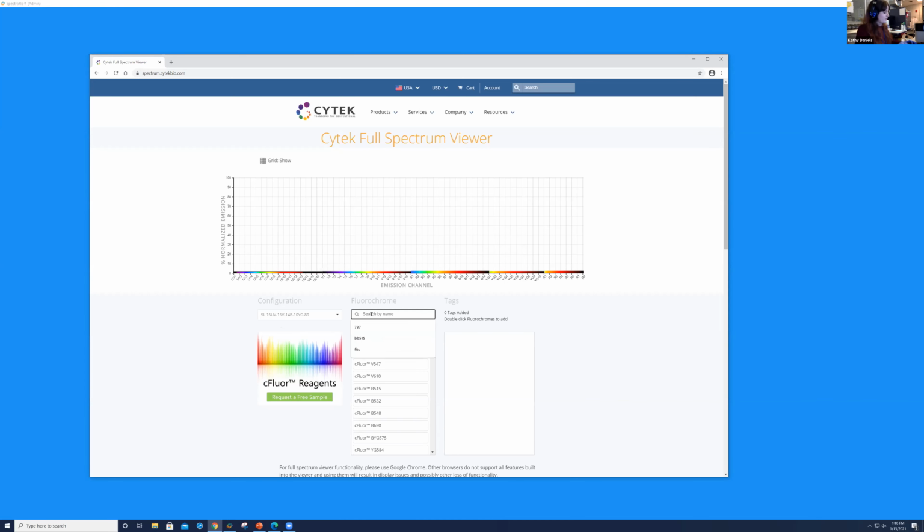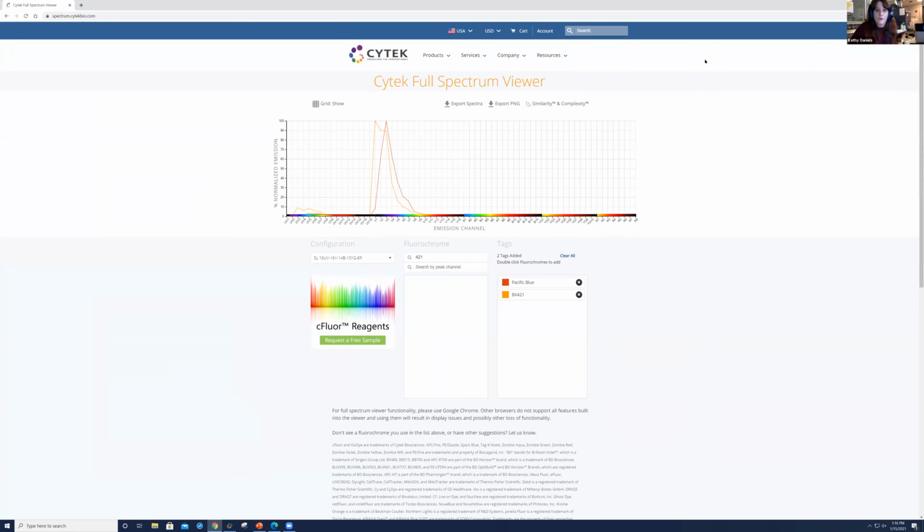And I'm going to start searching for those two fluorochromes. So Pacific Blue is my first fluorochrome that I'm going to be using today. And by double clicking on it, we see the emission spectra on this full spectrum plot. From there, we're going to add in BV421. So I start typing in 421, it pops up, and I double click on that fluorochrome right here. Once that pops up, you can see that we do have 2 distinct emission spectra. So this might be something where you look at it visually and you say, oh, I think there's a good chance that we are able to pull out these 2 fluorochromes from each other.